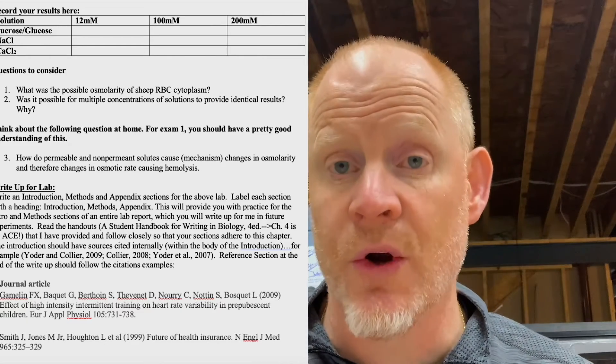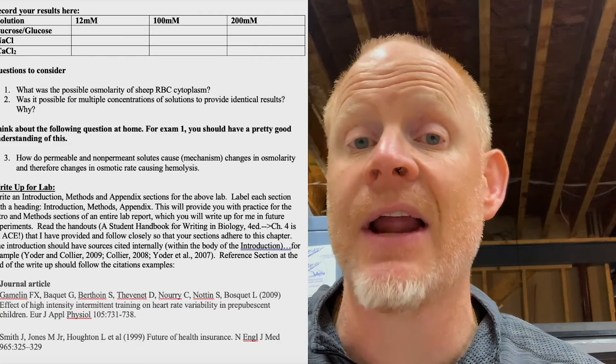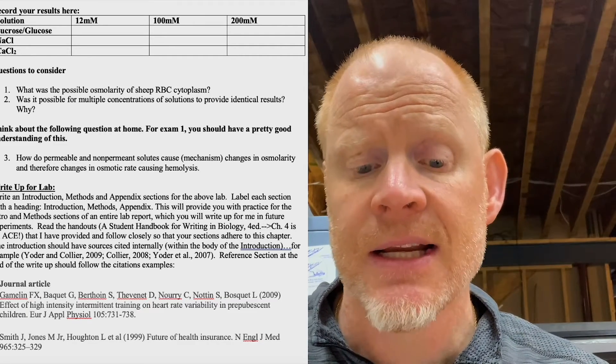The second part of the lab uses non-permeable, or non-penetrating, solutes. We're going to use three different molecules: sucrose, which does not pass the cell membrane of red blood cells. Sucrose and glucose do not pass because red blood cells carry oxygen — they won't use it, they don't have any organelles. Sodium chloride and calcium chloride are the other two. What's interesting is that sucrose, sodium chloride, and calcium chloride all have different osmotic effects at the same concentration. Sucrose doesn't break down into anything, so its molarity equals its osmolarity.